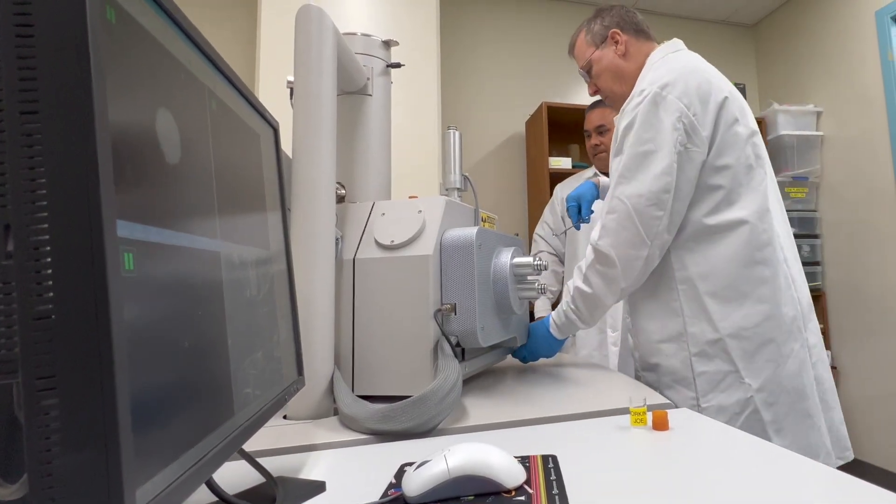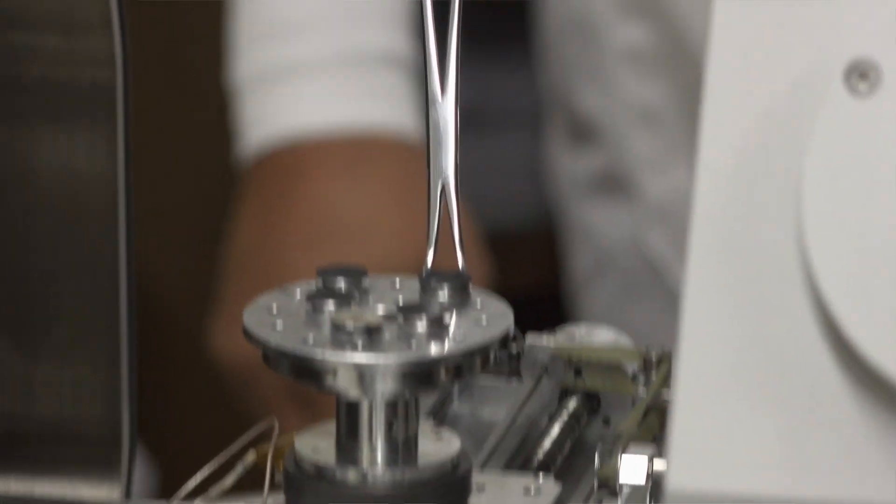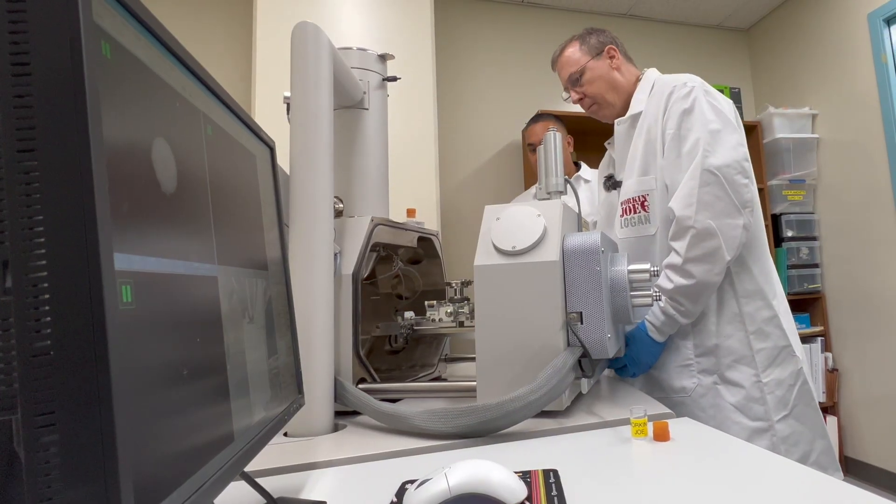Now open the chamber and then you're going to put it in one of those slots there. There you go. Like just like that. Perfect. Now you're going to close it.